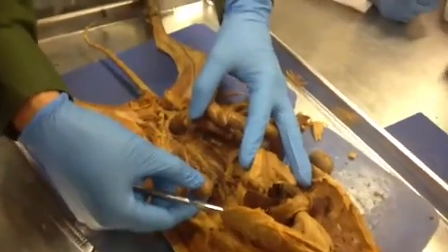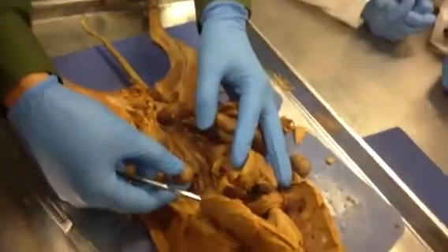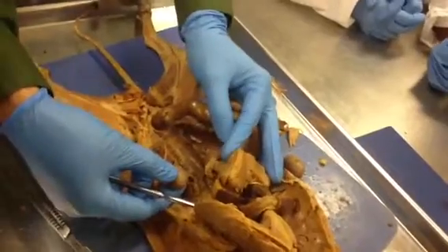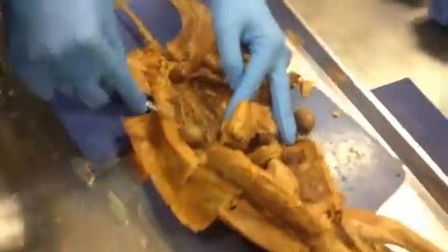Left and right are very important, guys. Never ever forget that this entire semester. Left and right, always. Don't just write kidney. Left kidney. So this structure coming down now.